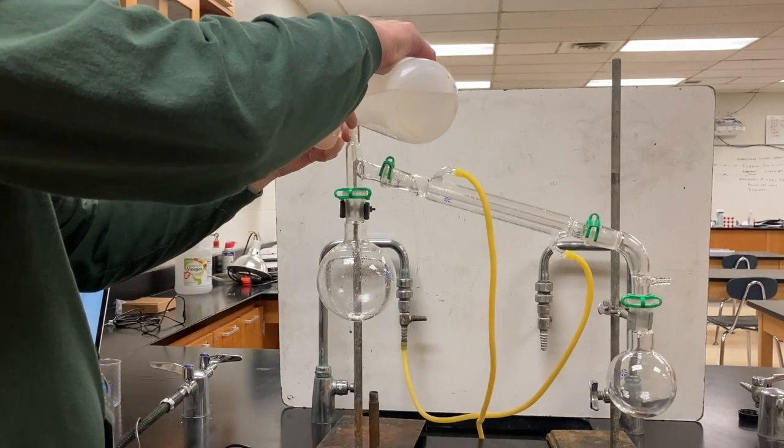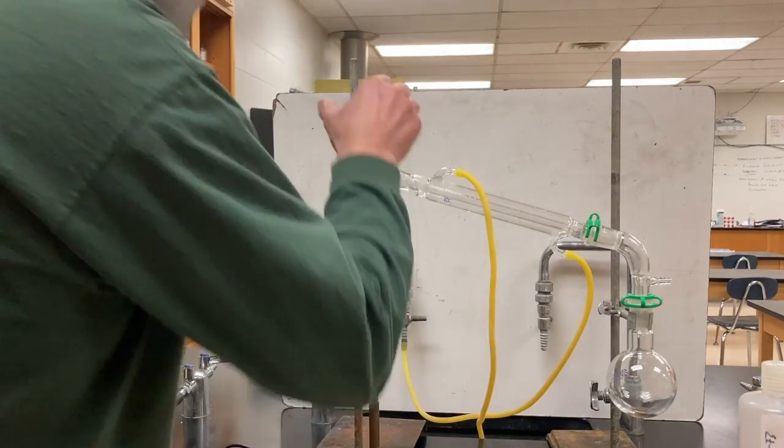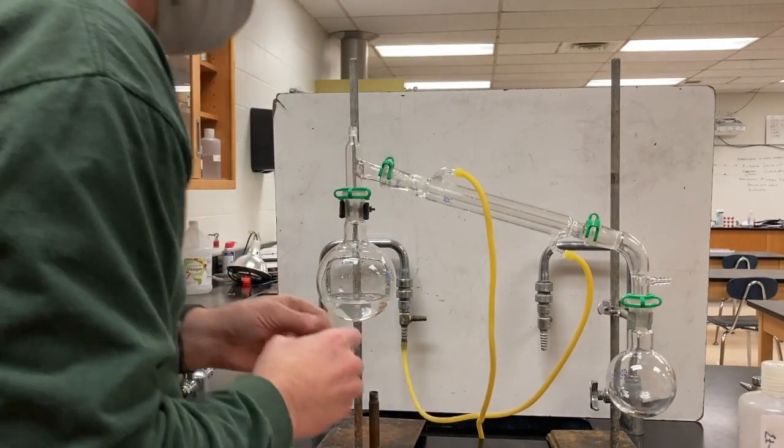And I'm going to be using distillation as a way of separating this mixture. So I'm pouring my mixture into the hot end of a distillation apparatus.